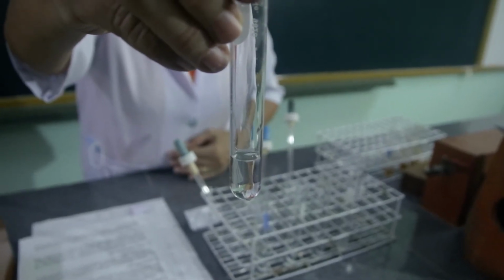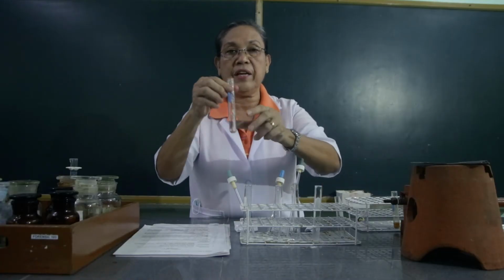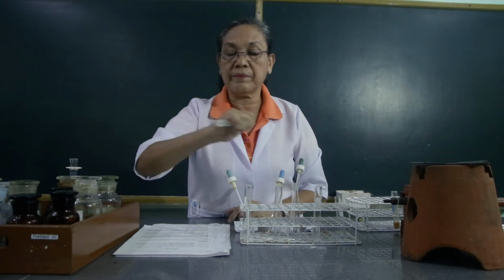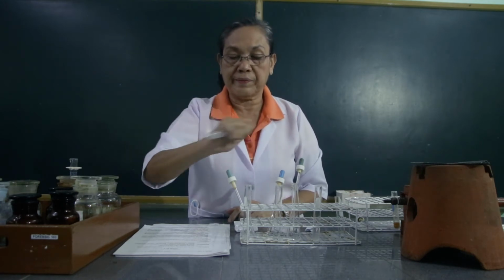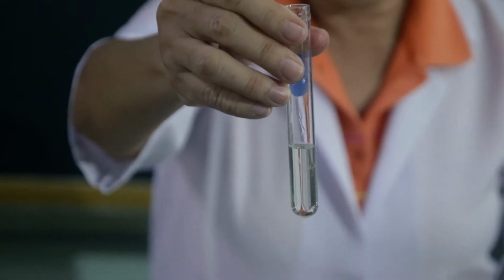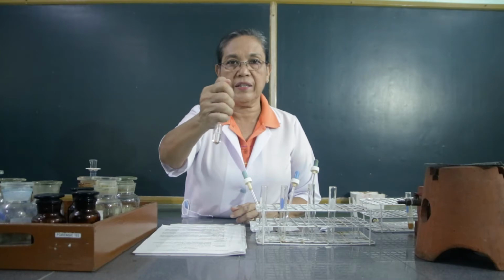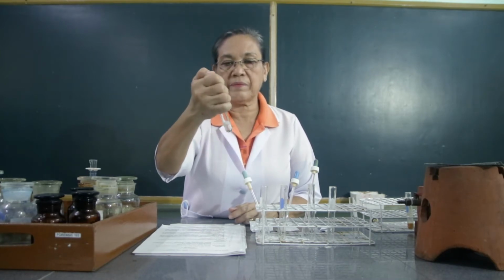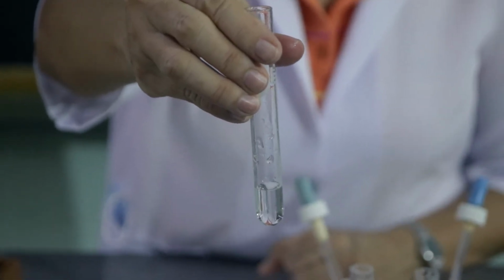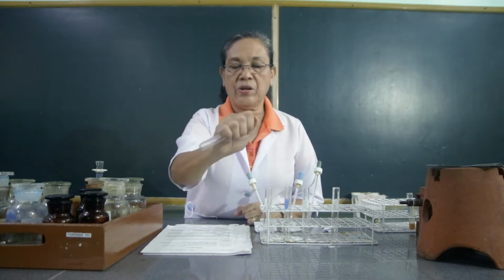So look at the arabinose. This is the arabinose after it has been shaken with water. Then the second test tube containing the fructose, which we added with water. Let's shake it, whether it's soluble in water. So this is fructose shaken with water. This is the glucose added with water, and let's shake it to test its solubility. Then this is the table sugar or the sucrose added with water. Then let's shake it whether it's soluble in water.